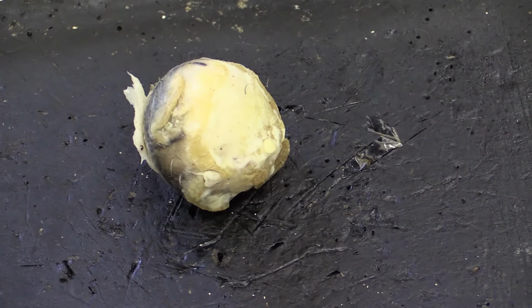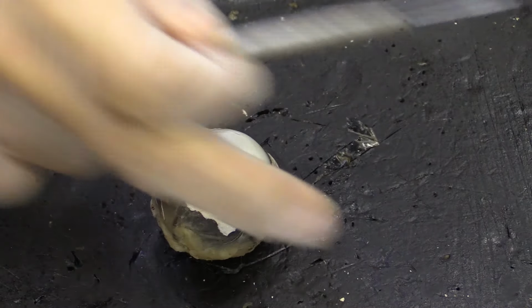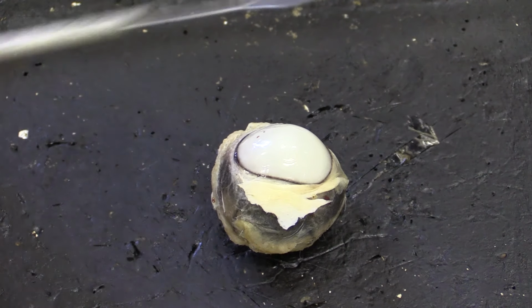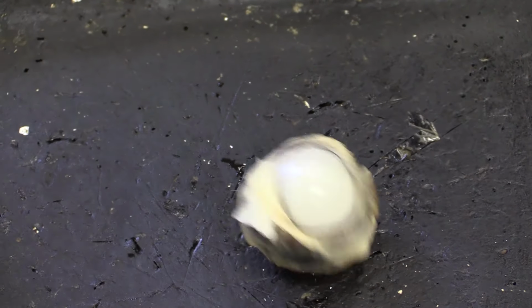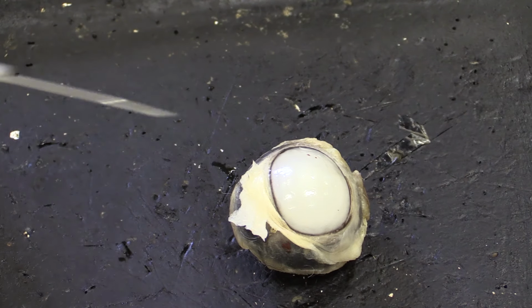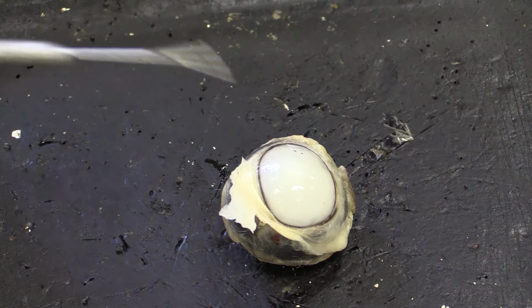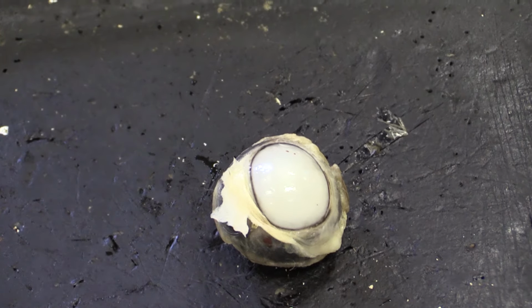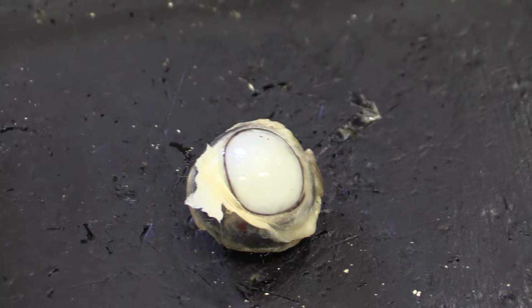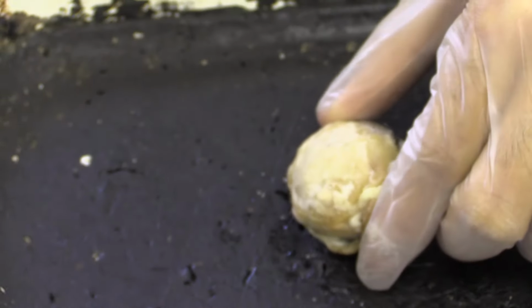And now we can look around the eye, and here you can see all this fatty tissue, this brown stuff, and this is commonly known as periorbital tissue, meaning around the eye tissue. And it consists of connective tissue, fat, and these are all important for shock absorption because they're very delicate and very sophisticated internal parts of the eye which need to be protected, and the fat acts as a really good shock absorber.